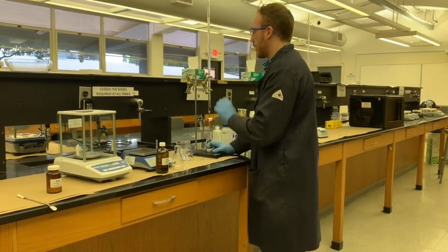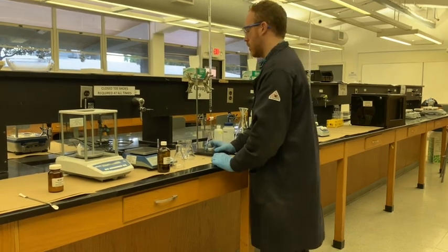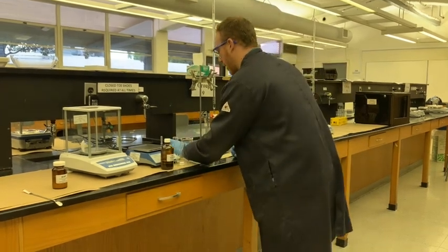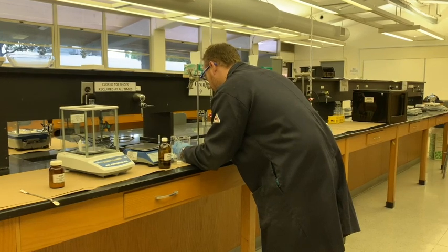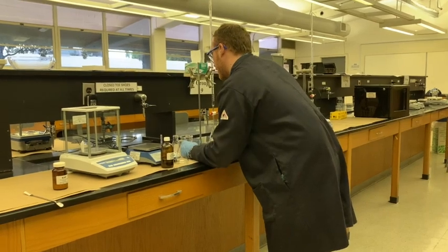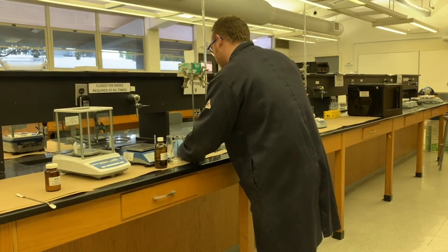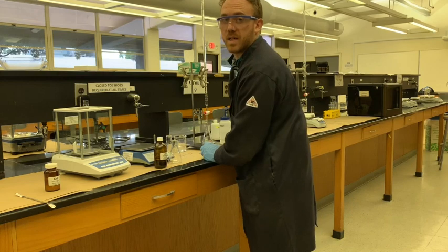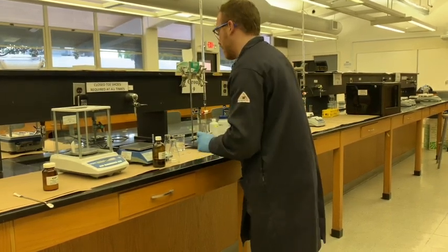I'm going to add a specific aliquot of the H2SO4 solution. So I'm going to actually record exactly how much. So for aliquot 1, or for sample 1, you'd measure this just like you would measure the other samples, with a start and an end volume. Trying to get as close to 5 milliliters as possible, but the actual volume is what matters. So don't stress so much about the 5 milliliters.